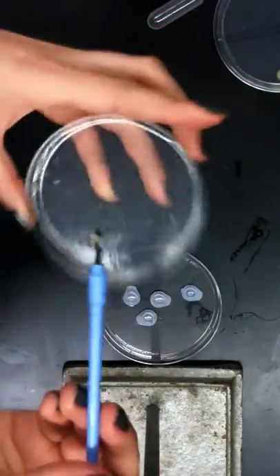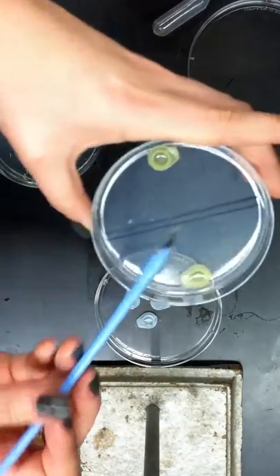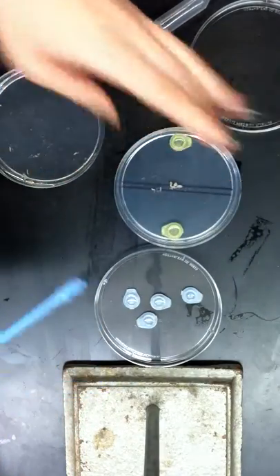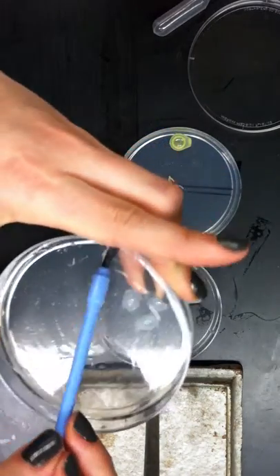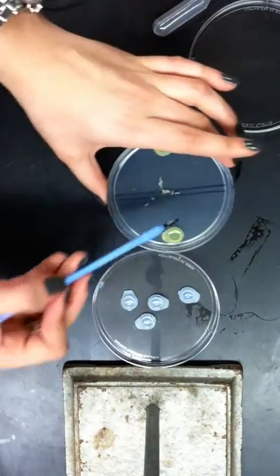And once you get a good amount, you want to transfer them to this middle strip. You could do it in two passes if you can't get all of them in one. Continue, go back to the other plate, pick up as many more as you can, and put them on the center line again.